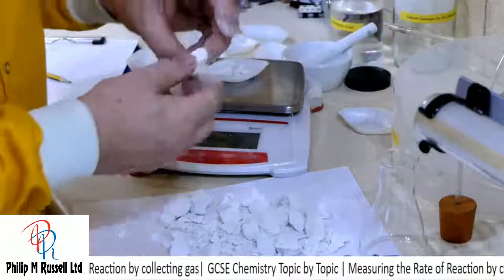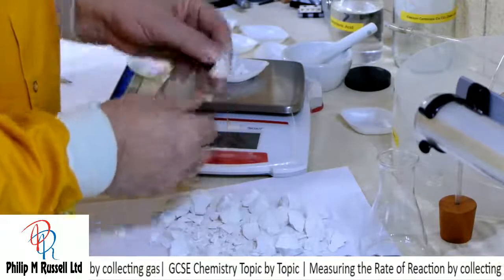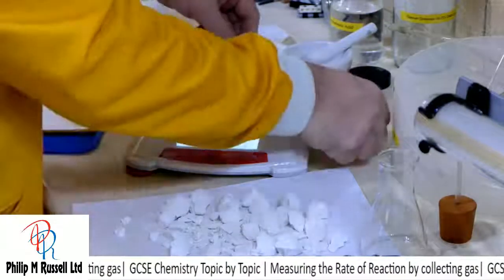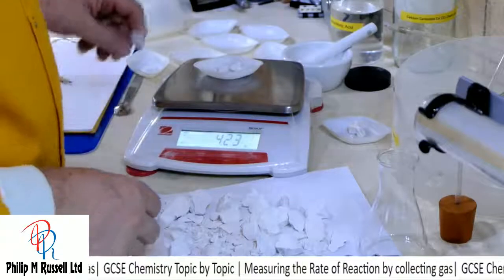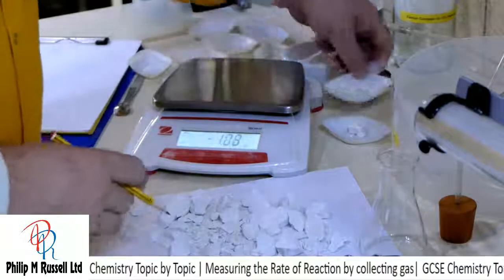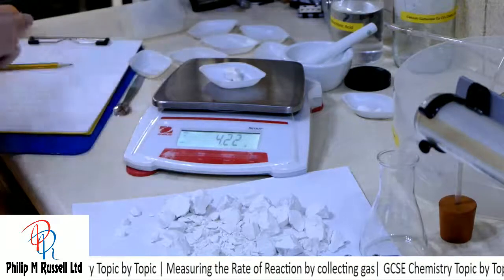So I'm going to... that's sad, it broke really easily. Alright, we'll do that again. So we've got this that's 4.2. And that happens to be 4.2. Right, okay, so that'll do. Small is 4.23 and my large piece is 4.22. I'm not going to do much better than that.